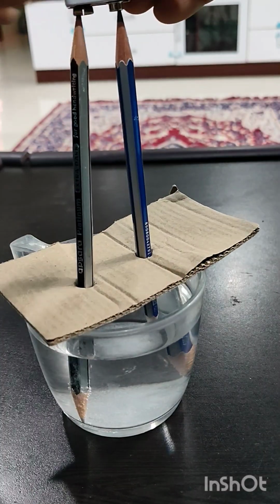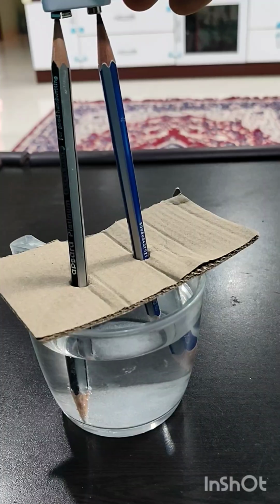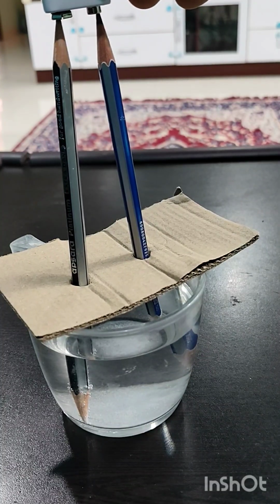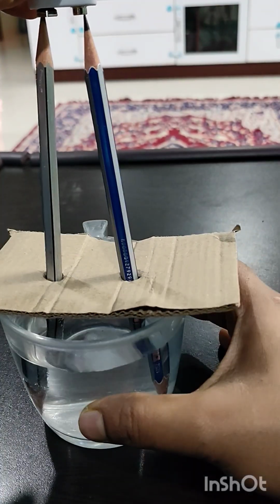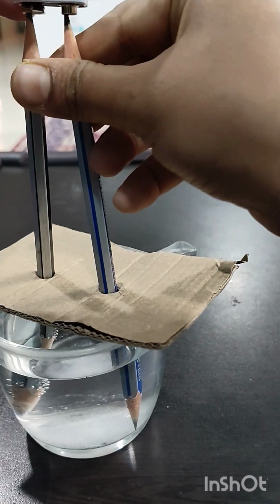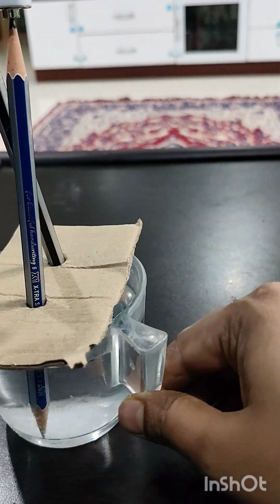What happens here is the breaking of water through the electric current. Such chemical decomposition of a conducting liquid through electric current is electrolysis.